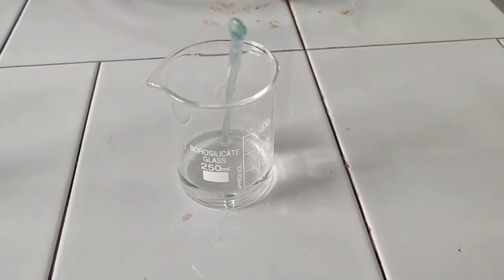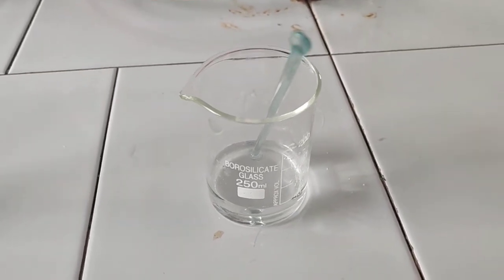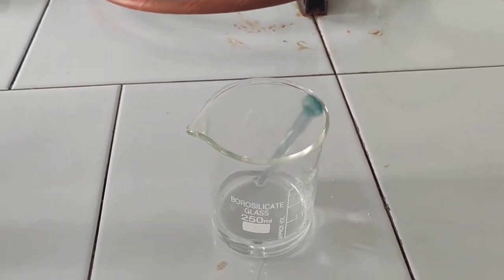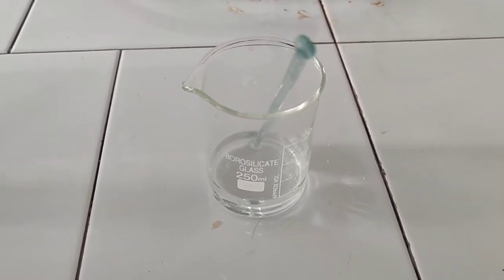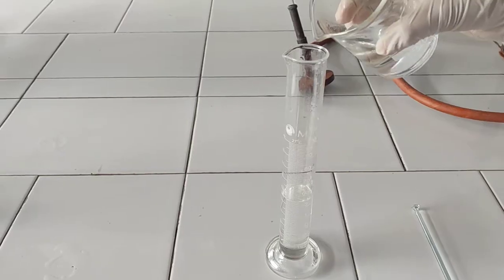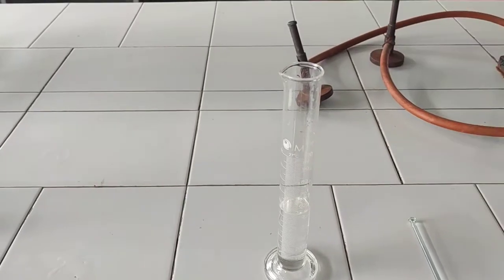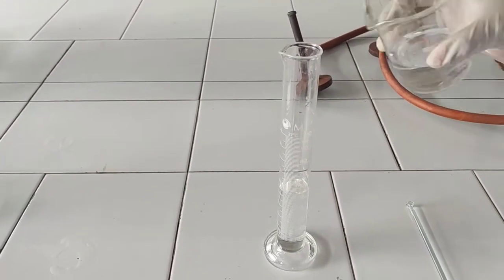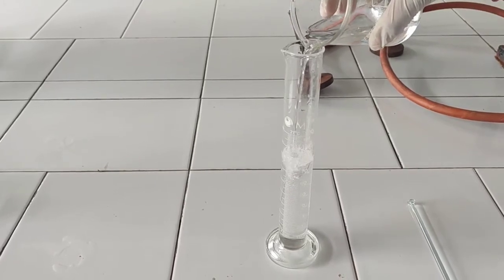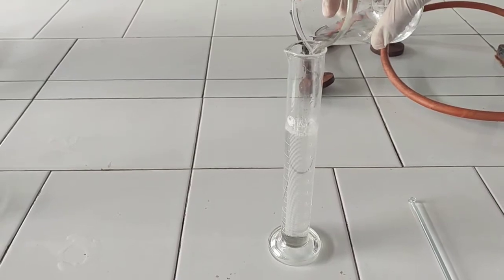Next, we need to filter the sodium chloride solution. We will filter it in the laminar air flow, and you will learn how to filter it and what the procedure is. We added it to the measuring cylinder — sodium chloride infusion at about 50–60 ml — then made it up to 100 ml with water for injection.